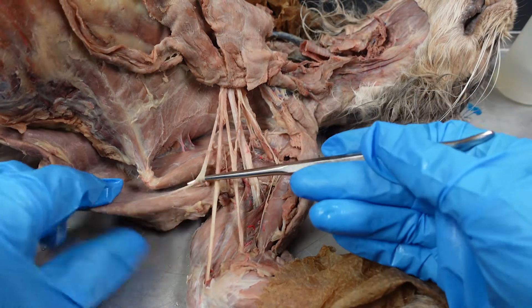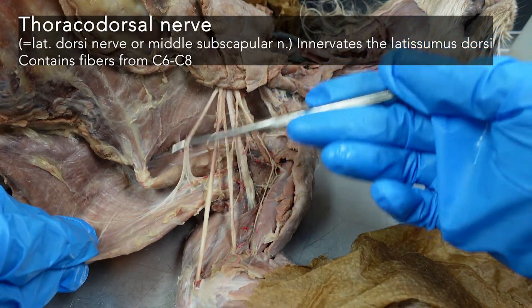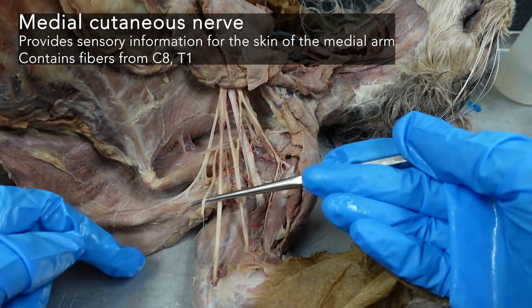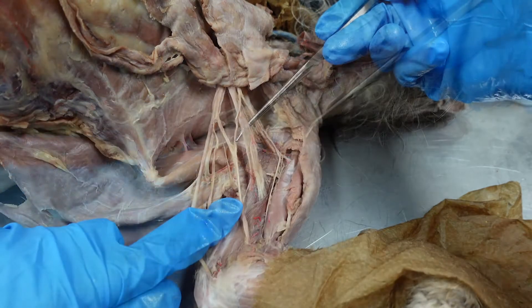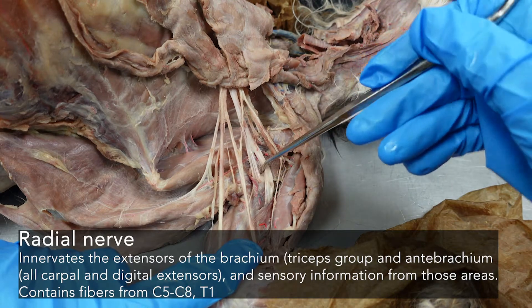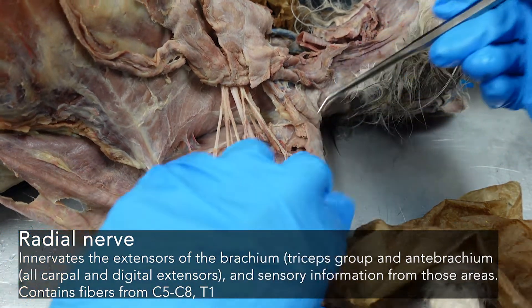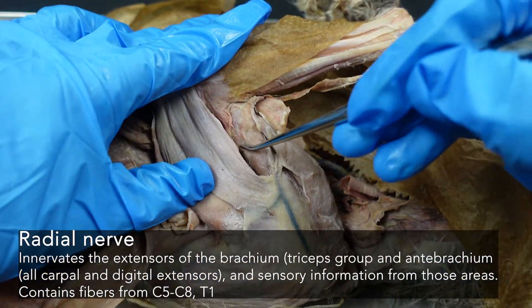Over here to the latissimus dorsi, we have the thoracodorsal nerve — the lat dorsi nerve — off to the side. This is disconnected because the skin is removed. The medial cutaneous nerve and the big radial nerve, which we can actually see dividing into an aspect that innervates the extensors of the brachium, then diving deep and passing around to the extensor of the antibrachium — let's see that coming around right here.